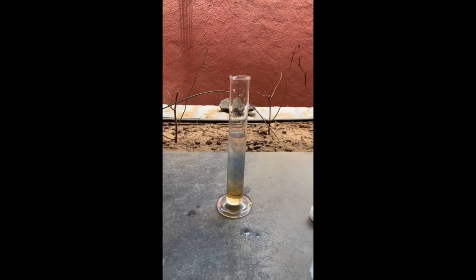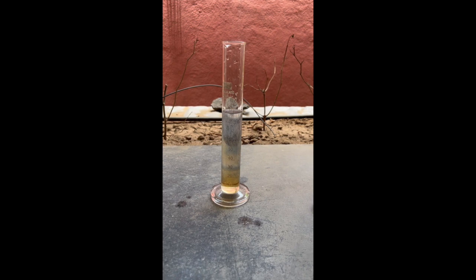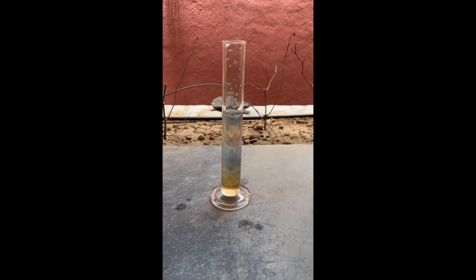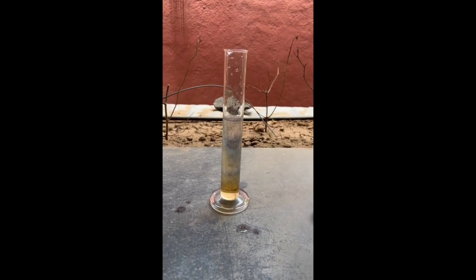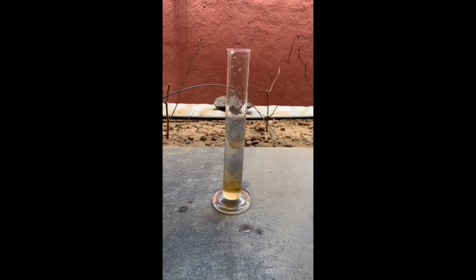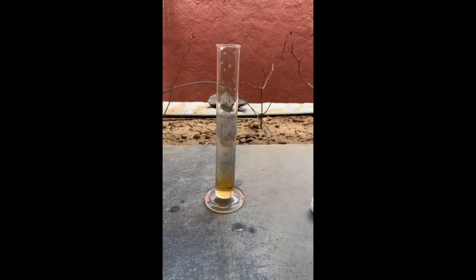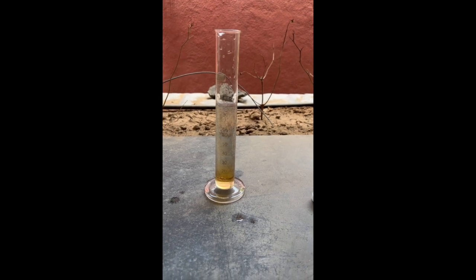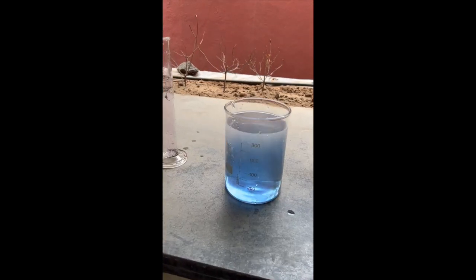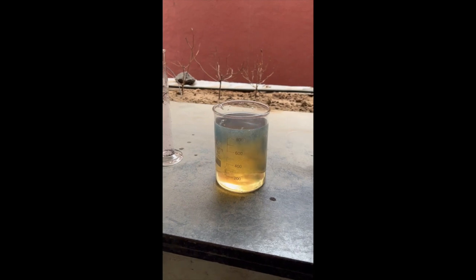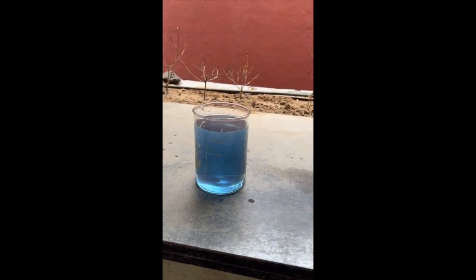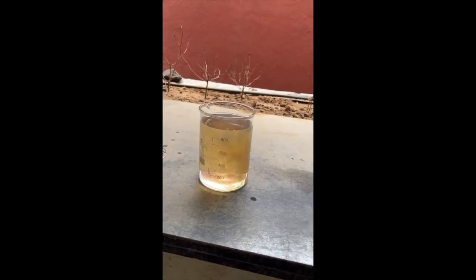I tried doing this again and somehow the results were even more satisfactory. But it was real fun when I took all the three solutions in the beaker and mixed them together. It was extremely fun to watch this continuously change colors and I think this was really cool.